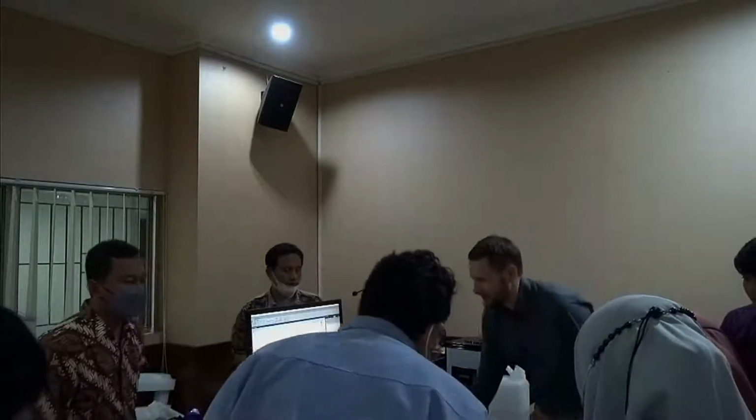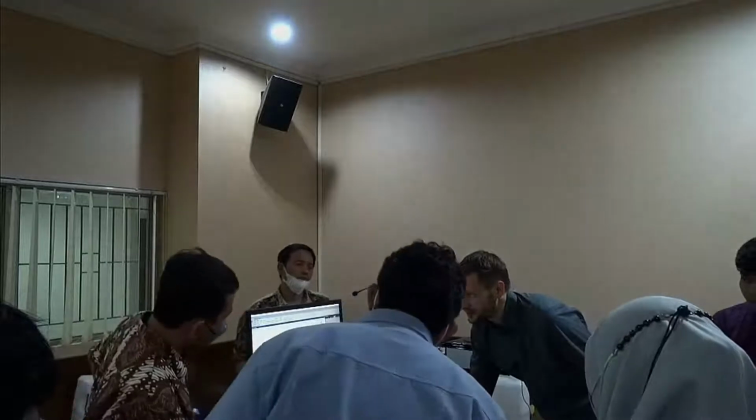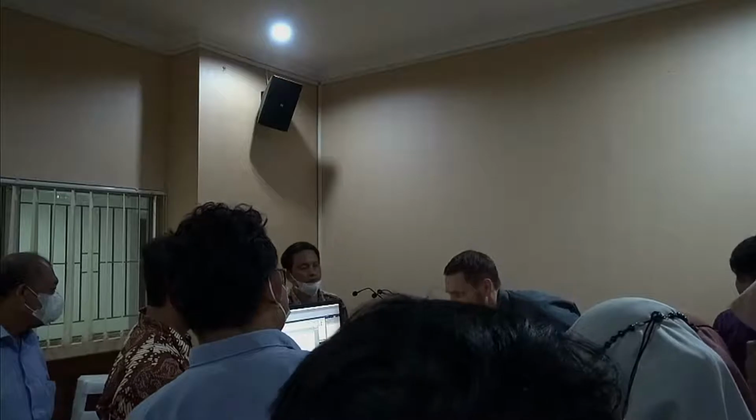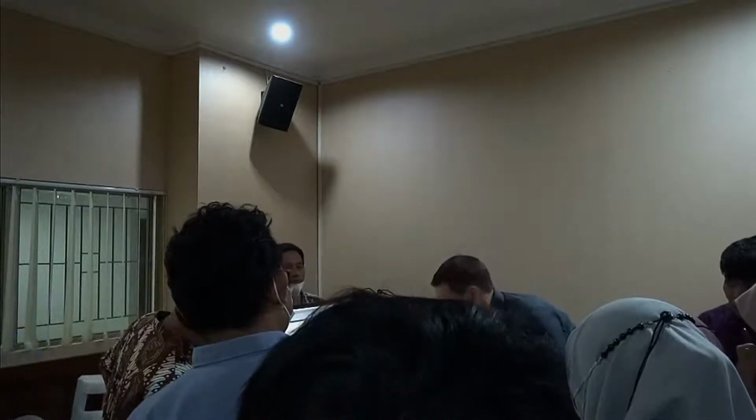Coconut milk is actually also quite special in that it consists of both a dispersion and an emulsion, because you have fat and you have particles. You have both, which usually would make it more complicated. I know the coconut milk actually is quite an easy sample. We will come to more complicated ones later, but just to show something organic, something very common, which you just go to the supermarket and buy.